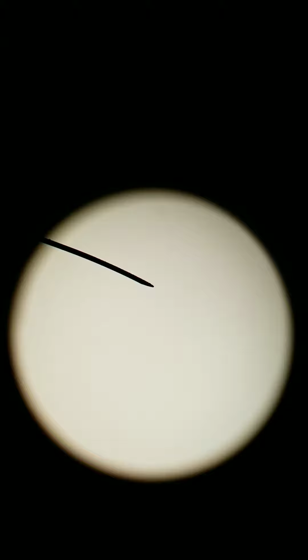Today we'll be looking at different tissues under different section types. When we cut tissue, we can cut samples in one of two ways. There can be a cross section, which is a lot like a horizontal or transverse section on a full body, or we can do a longitudinal section, which is where you cut something long ways. Think of cross section as the hamburger cut. Think of longitudinal section as the hot dog cut. Hamburger is a rounder cut, and longitudinal hot dog is longer.